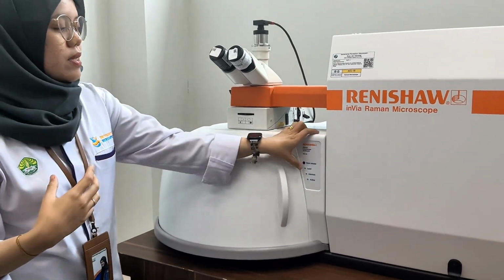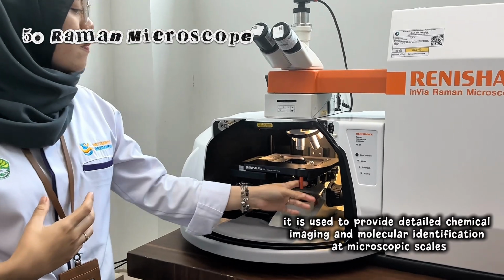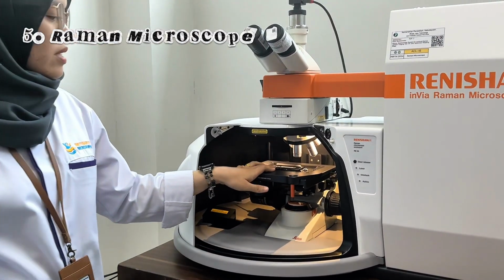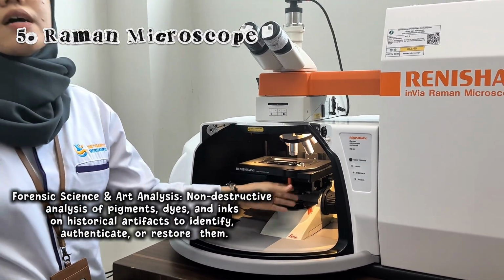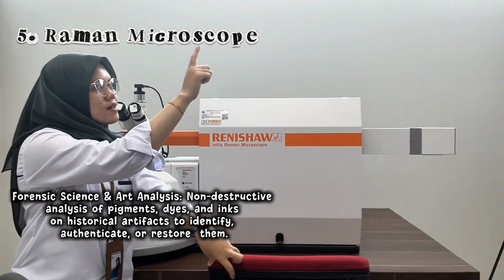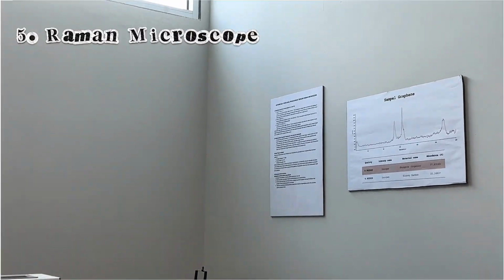Next, they have the Raman microscope. It is used to provide detailed chemical imaging and molecular identification at microscopic scales. One of the experiments that use this equipment is forensic science and art analysis: non-destructive analysis of pigments, dyes, and inks on historical artifacts to identify, authenticate, or restore them.